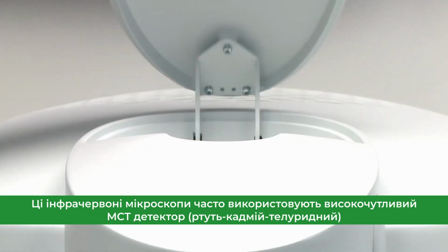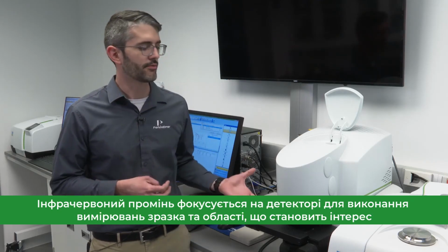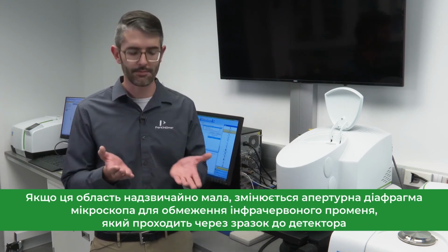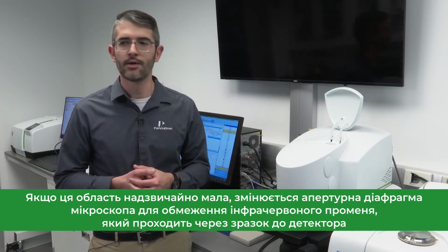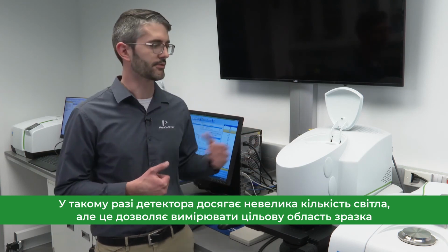These infrared microscopes will often employ what is referred to as an MCT detector. The infrared beam is focused to perform measurements of that sample and that region of interest. If that region of interest is extremely small, apertures are employed to restrict the infrared beam which travels through the sample to the detector. Because apertures are employed, a small amount of light is actually able to reach the detector.